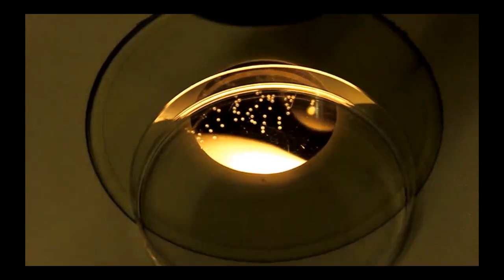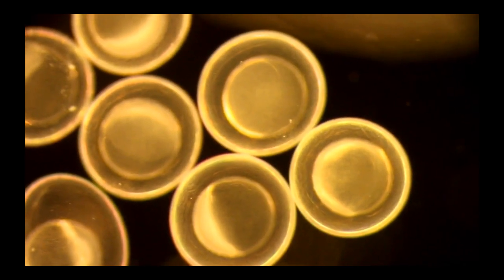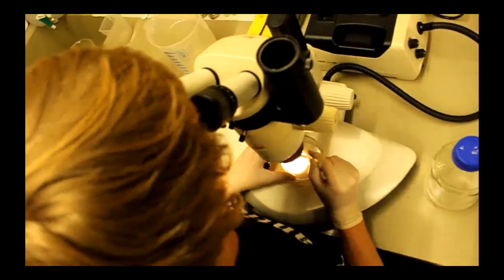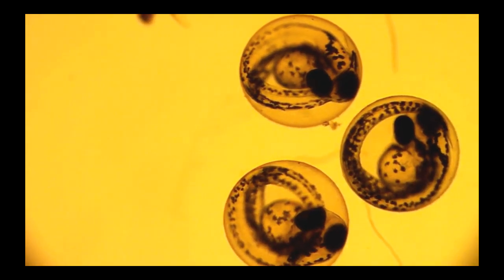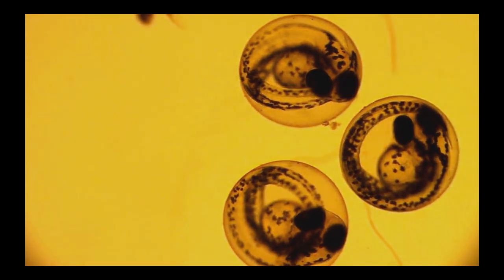Random mutagenesis is performed by exposing animals to radiation or chemicals. A common substance in this concern is ethyl nitrosourea, or ENU, which is a highly potent alkylating agent that mainly takes effect on sperm cell precursors.